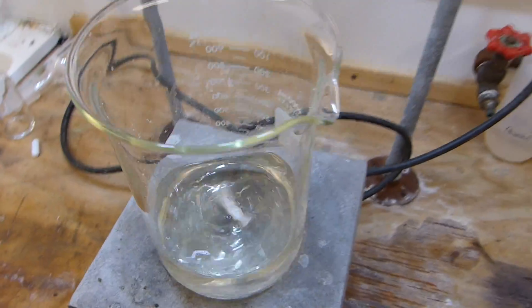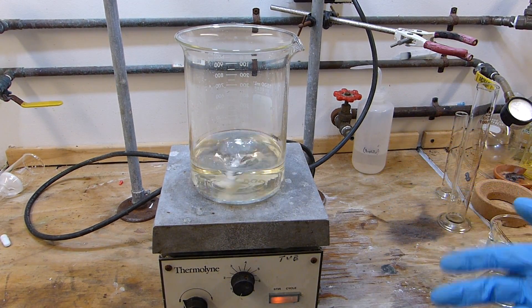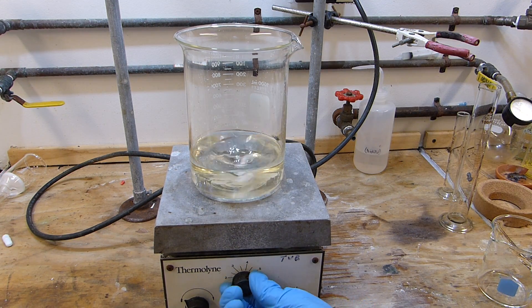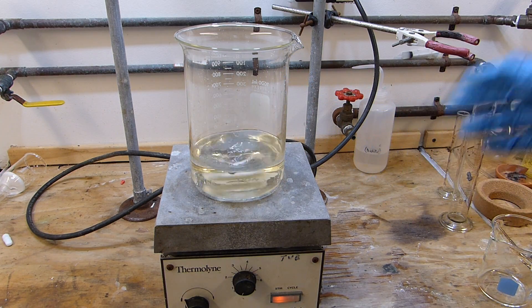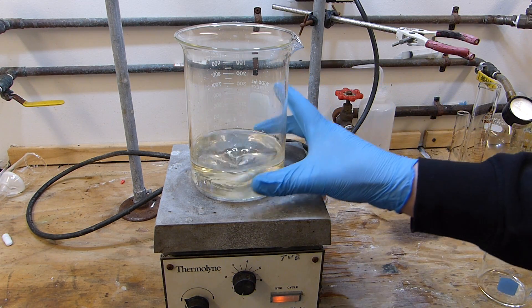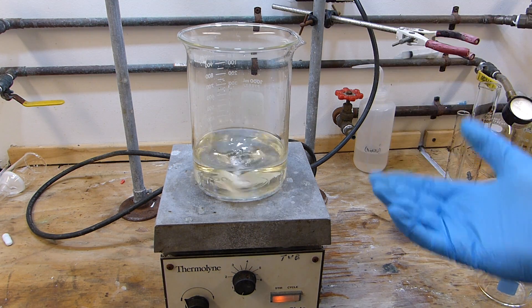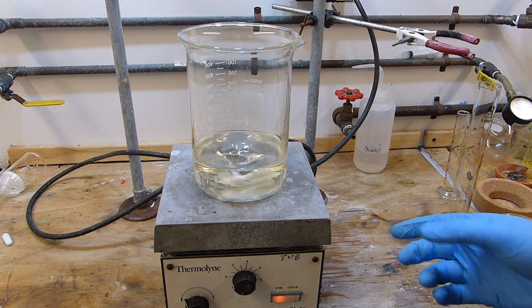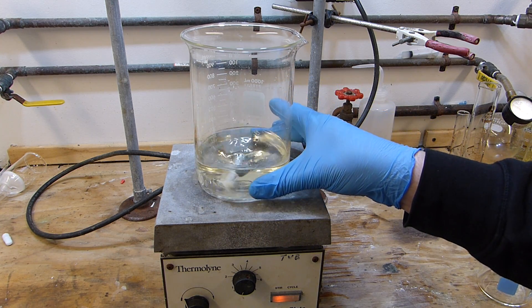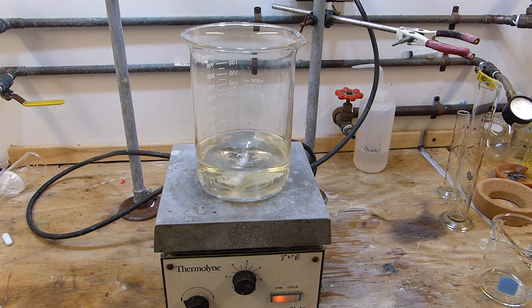All right, you can see that after about 10 minutes of stirring and heating the reaction mixture has completely homogenized, and that's good. That means that everything is dissolved and it can now participate in the esterification reaction we're looking for. This is just going to stir while I turn the heat completely off, and it will sit on the warm hot plate and slowly come down to room temperature. That'll give the mixture time for the esterification reaction to happen, although I can assure you that it is right now almost complete. What will happen then is this will cool down to room temperature — we may even start to see dimethyl oxalate crystals coming out of solution already — and then this will end up in the fridge or freezer to get down to zero C so we can recover the maximum yield possible.